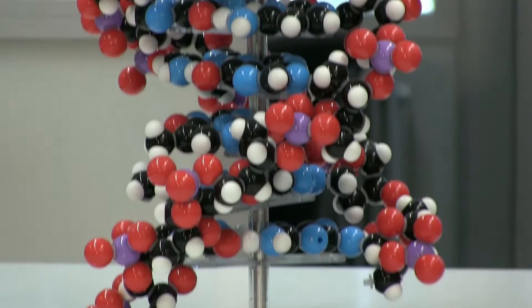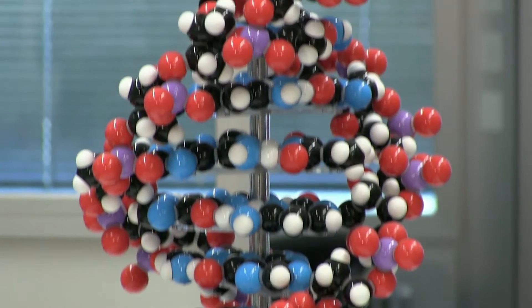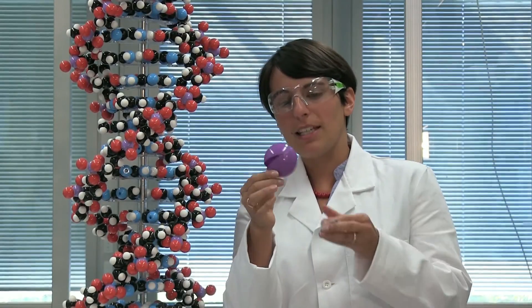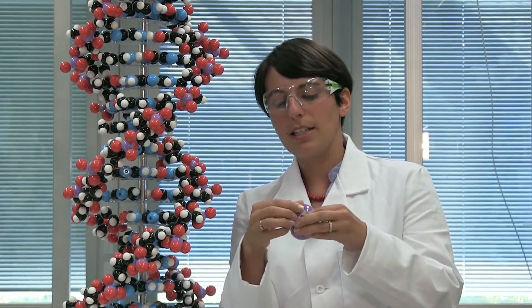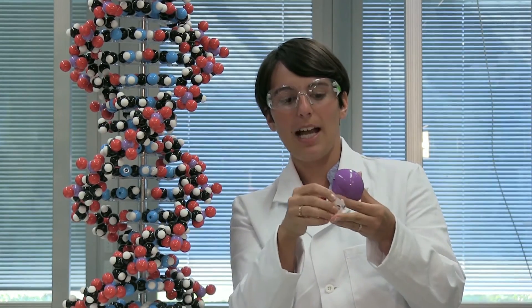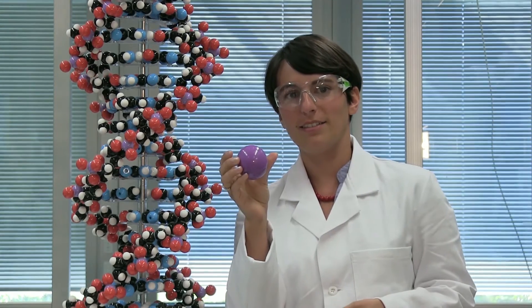So to be able to count nanoparticles, we invent a trick. We load nanoparticles with DNA. These purple balls represent nanoparticles, and the DNA inside helps us to count the nanoparticles.